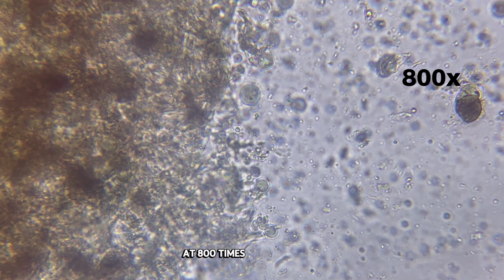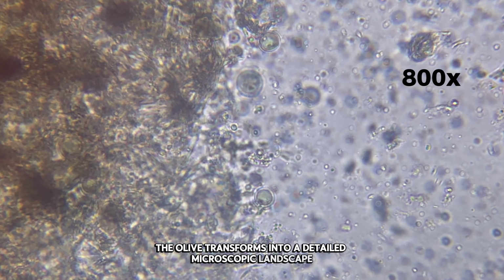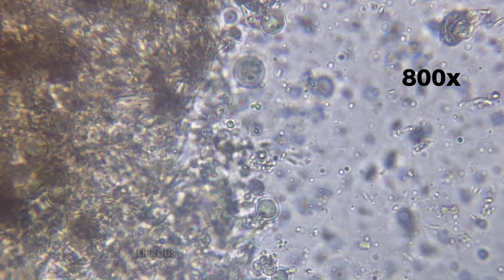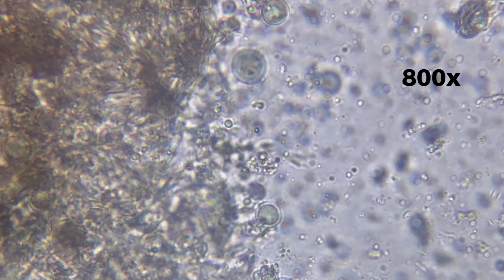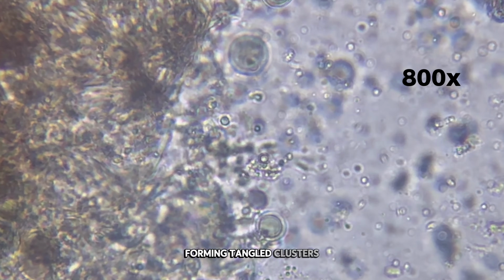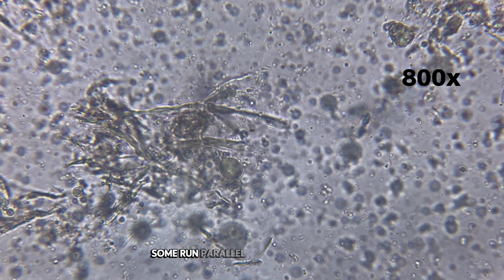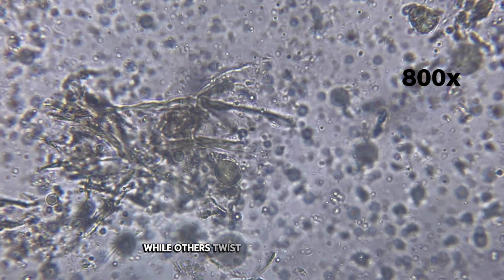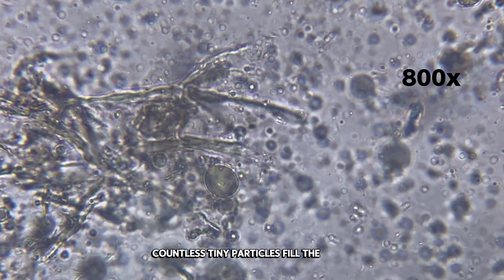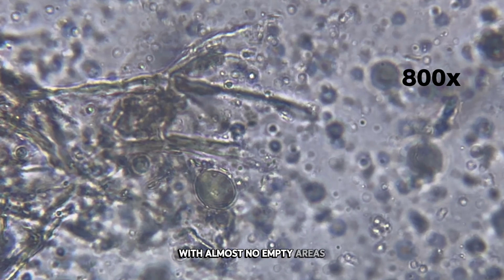At 800 times magnification, the olive transforms into a detailed, microscopic landscape. The field of view fills with fine textures and overlapping structures. Fibrous strands dominate much of the image. They appear thin, irregular, and densely packed, forming tangled clusters. These fibers vary in thickness and direction. Some run parallel for short distances, while others twist sharply and intersect. Between them, countless tiny particles fill the space. This creates a crowded and textured environment with almost no empty areas.